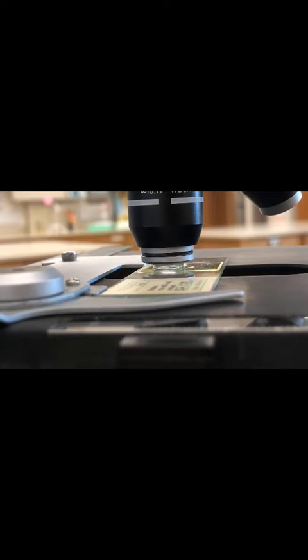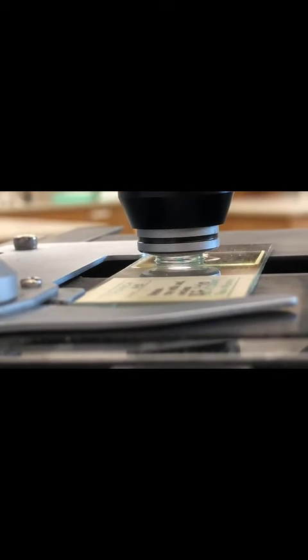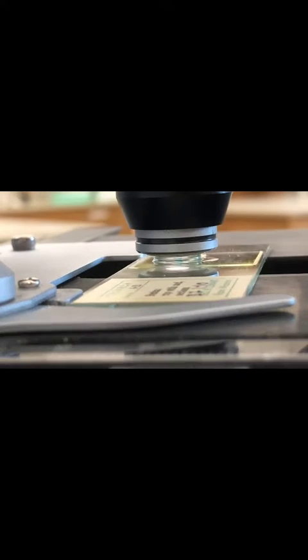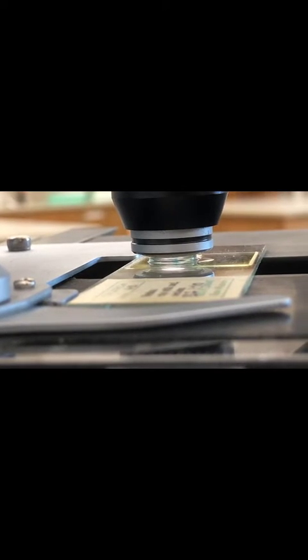Look at this. If you're in focus, the 100x objective will be touching the oil, and the oil is touching the cover slip. When you have that oil on there, you're going to get a really crisp, sharp focus on your specimen.